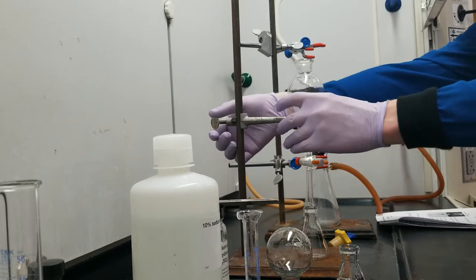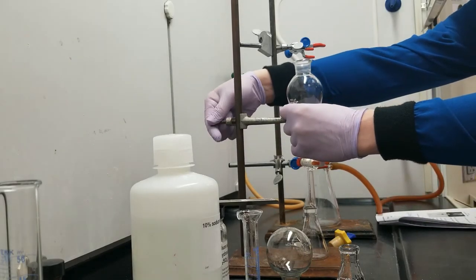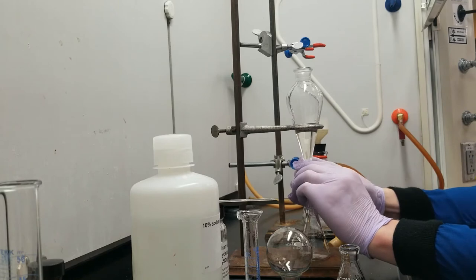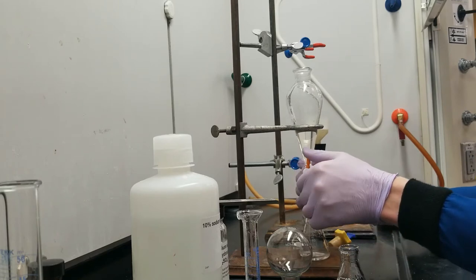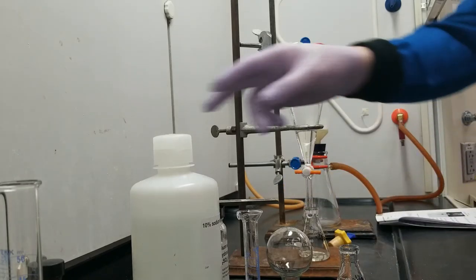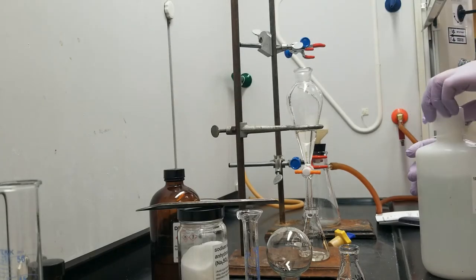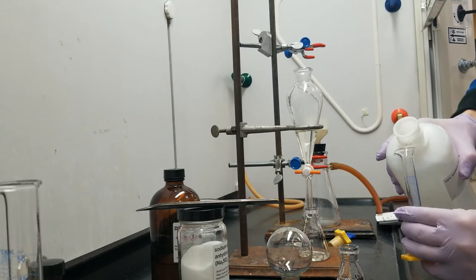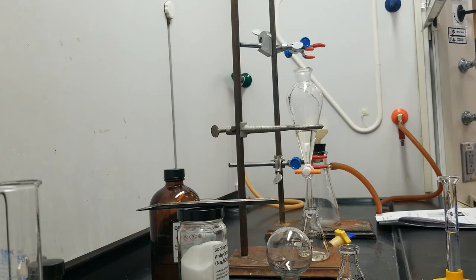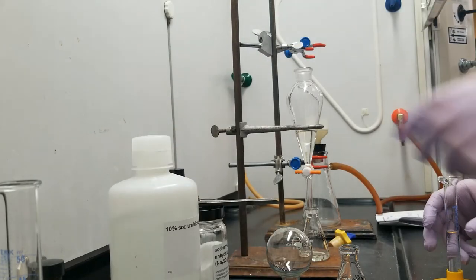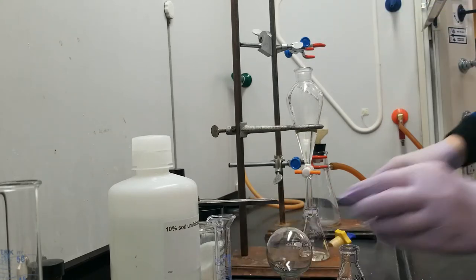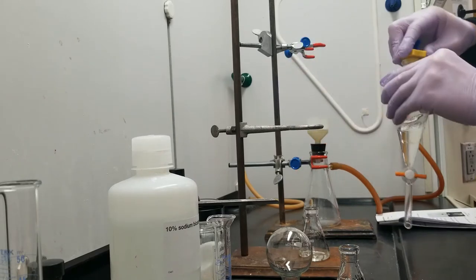And then I'm going to come back and I'm going to use just a little bit more bicarbonate solution to try to get any remaining out. I don't need to be super precise with that first extraction draining step because I'm just going to throw more water in here. So this one is a 5-milliliter extraction, just to double check. And let's shake again.